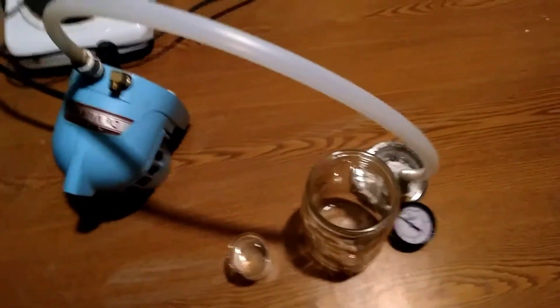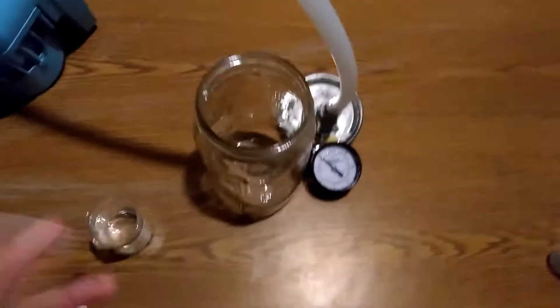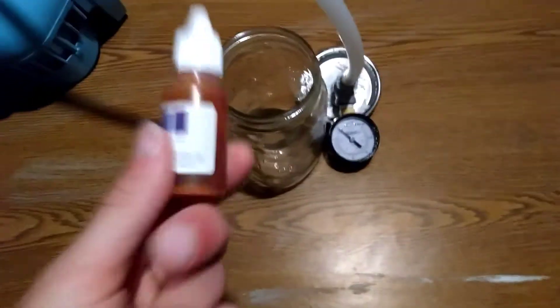Yeah, so let's test this. Approximately 50 milliliters of water from the tap and pH indicator. So let's go test the pH first.